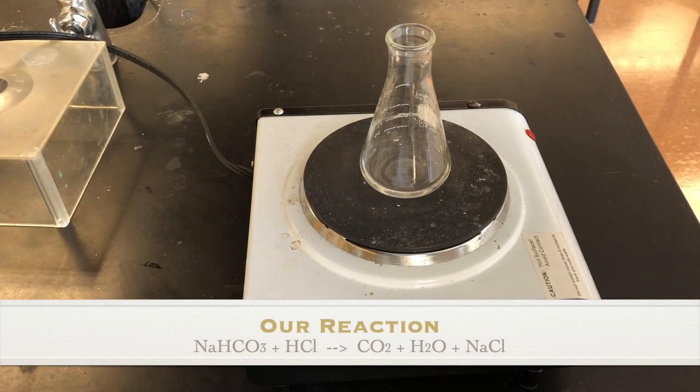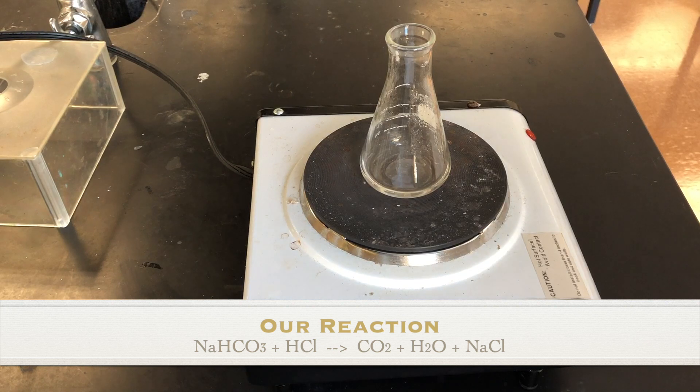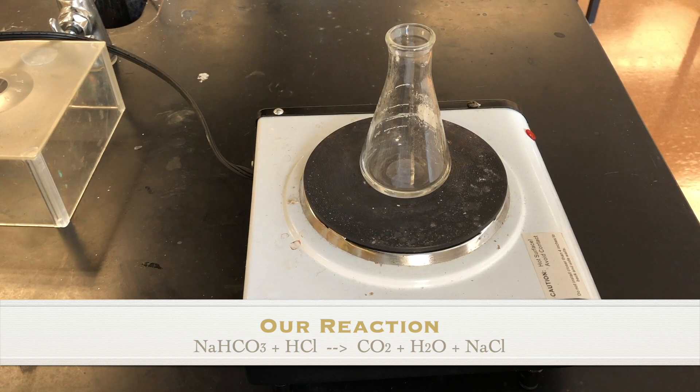Now that our chemical reaction is over, it is time to go to step five of our procedure. What we need to do at this point is to get rid of the water. Now is a good time to go back to your background information on the lab and look at the chemical reaction that we did today.